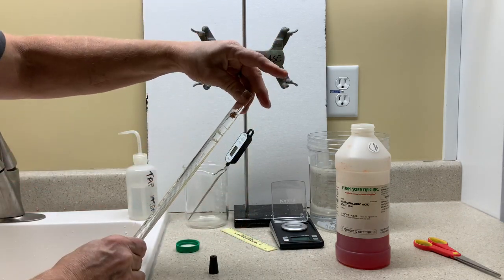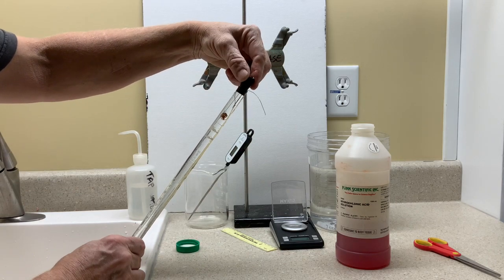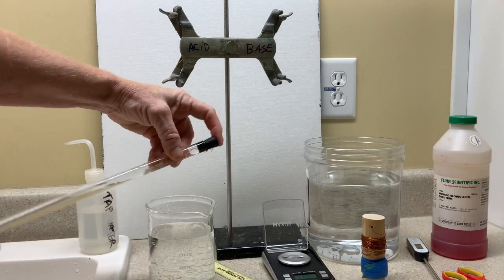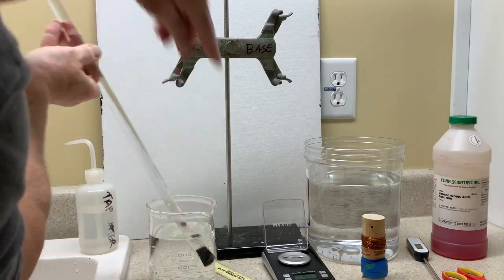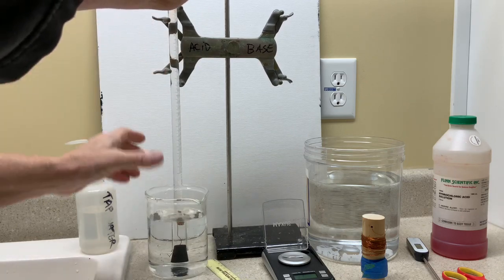Now the cage with magnesium is inserted and the stopper, which has a hole in it, is twisted gently. With finger over the hole, tip it upside down and place it into the beaker.